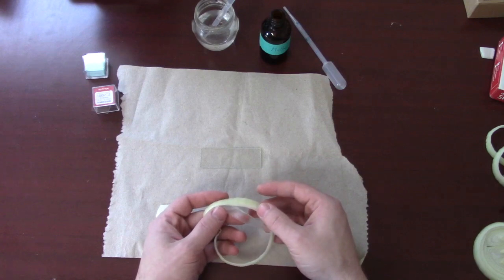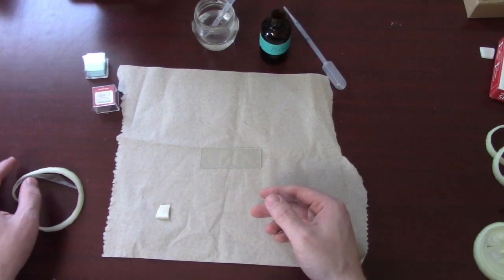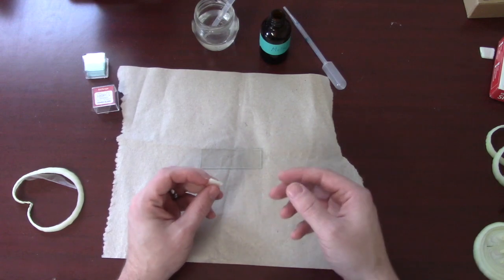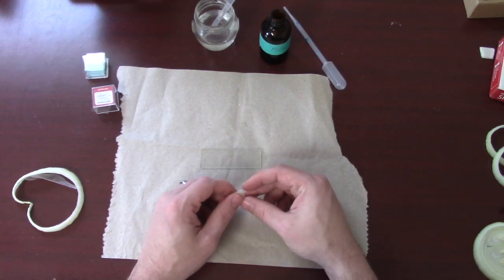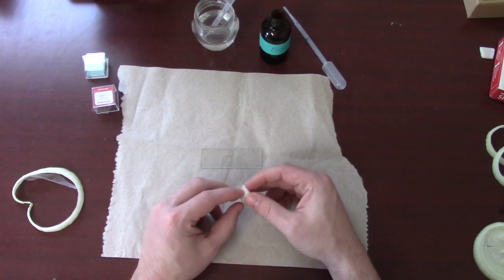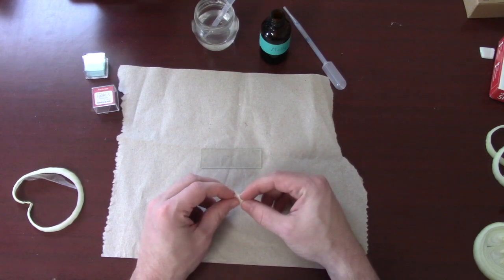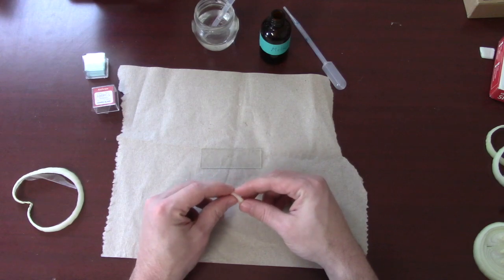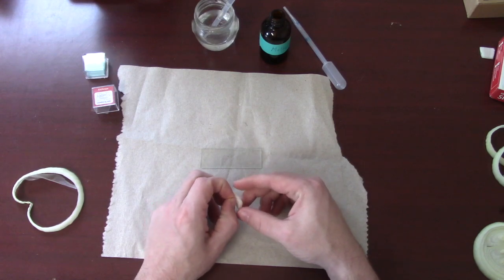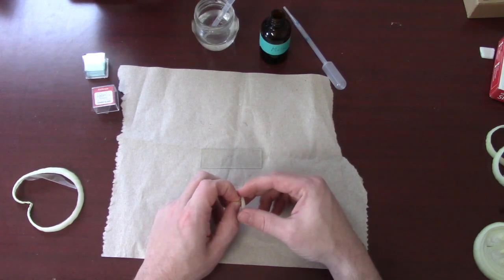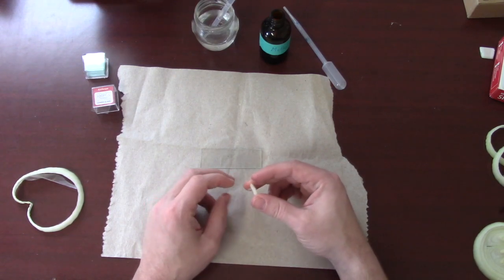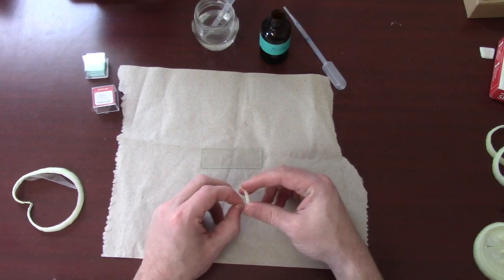The other thing that we want to do is this piece is going to be way too big. We want a smaller piece, something like this, or maybe even a little smaller. And what I like to do is I like to make sure that I'm finding the inside of the onion ring. And then you can just use your fingertips to peel that layer of cells off. Sometimes it might help to use a pair of forceps or tweezers, but most of the time your fingertips work just great. And once I have a hold of that layer, I'm just going to gently pull it off.